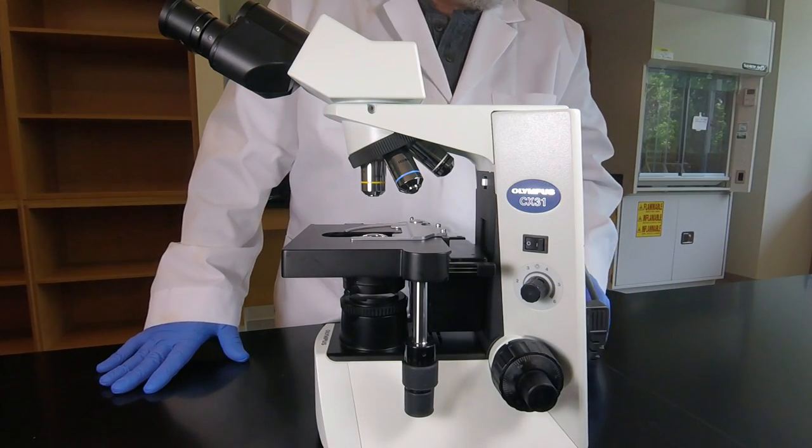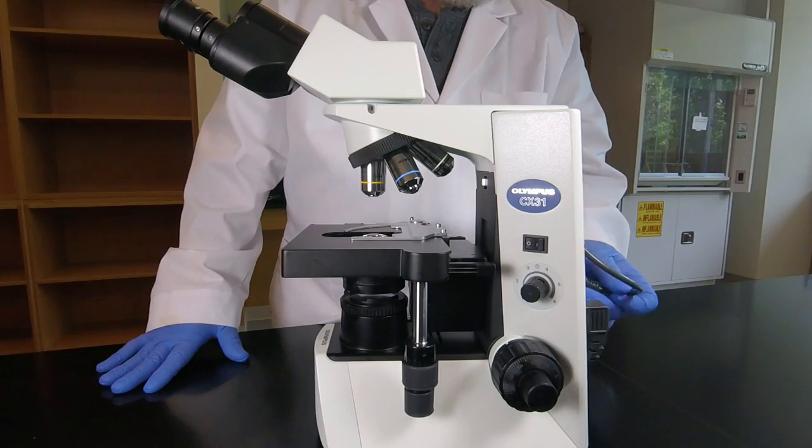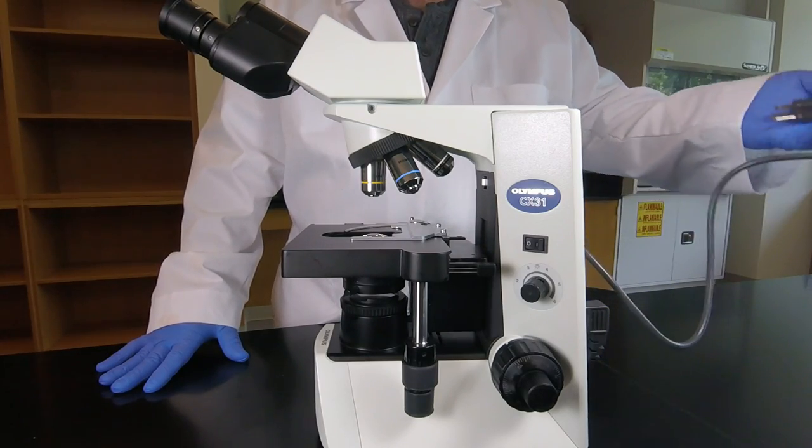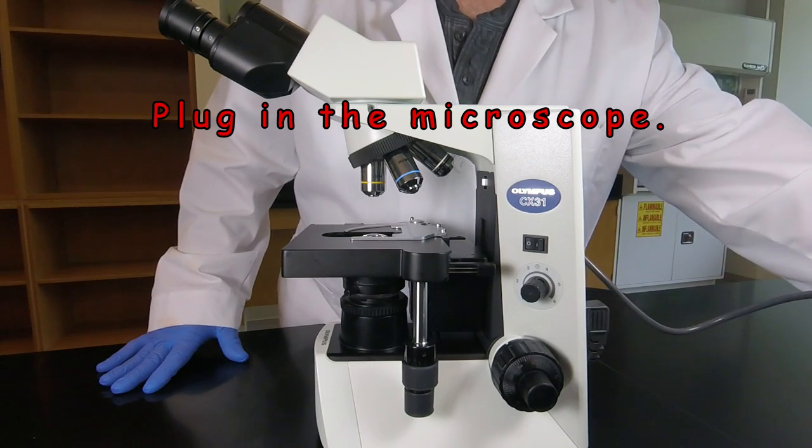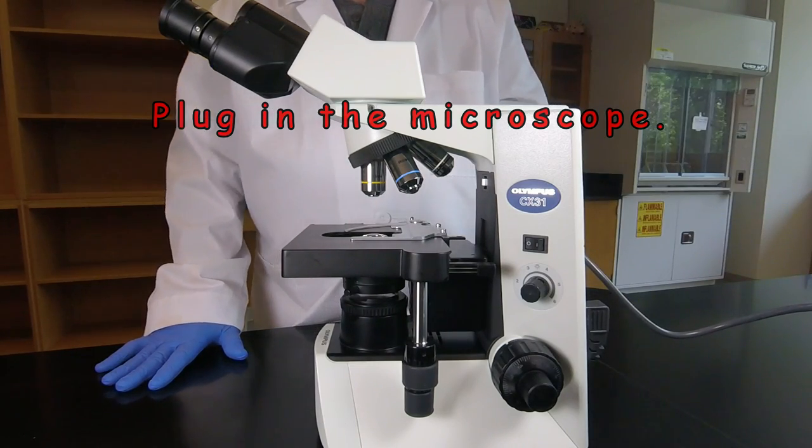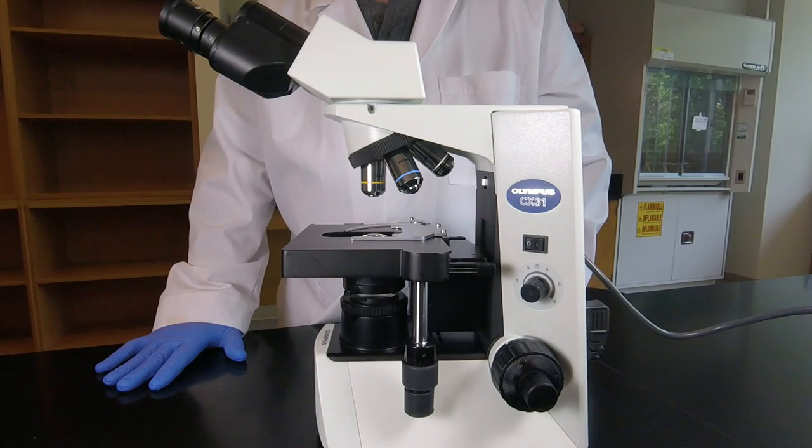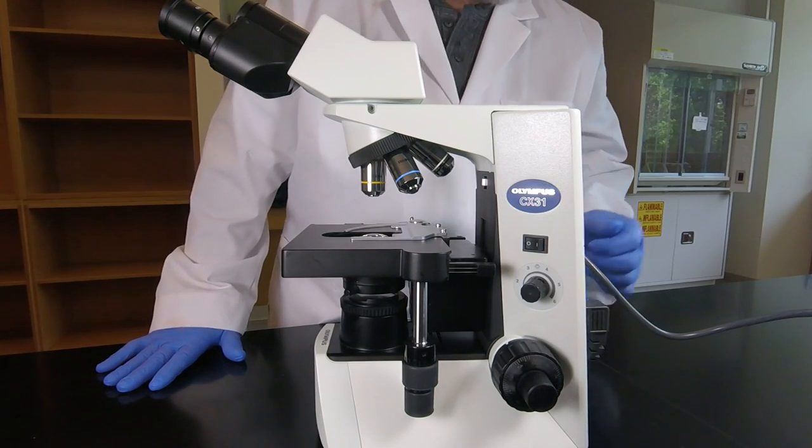Now, at that point, we can plug the microscope in. So we're going to remove the cord from the back and then plug that into the nearest outlet. Now, at that point, once the scope is plugged in, we can turn the microscope on.